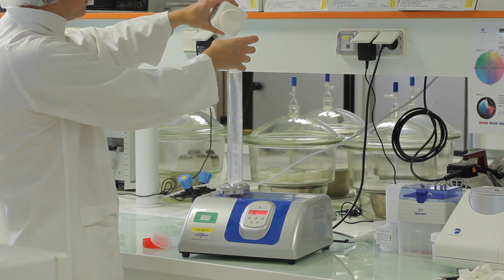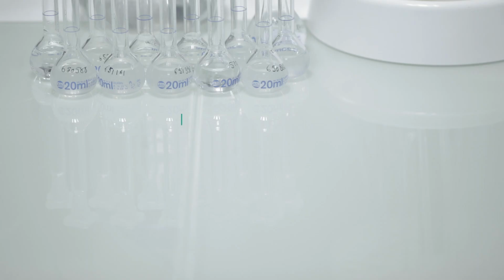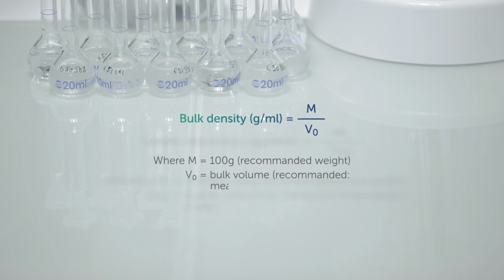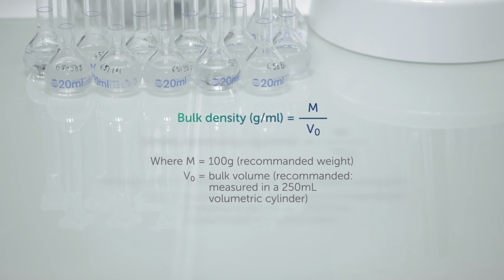Bulk density is the density of fresh and loosely discharged powder. It is the ratio of the untapped powder mass and its volume, expressed in grams per mL. Bulk density depends on both the density of the powder particles and on the arrangement of the particles. It is influenced by the preparation, treatment, and storage of the sample material.